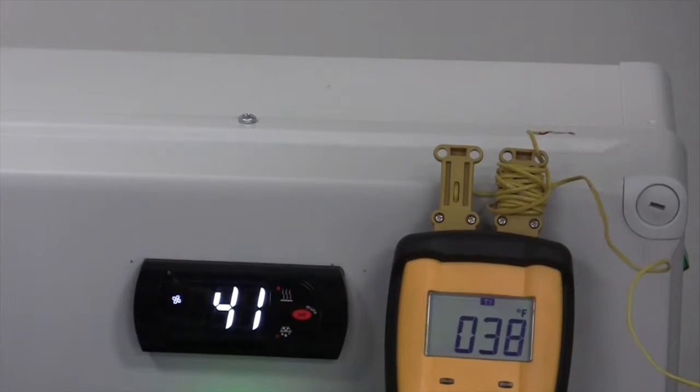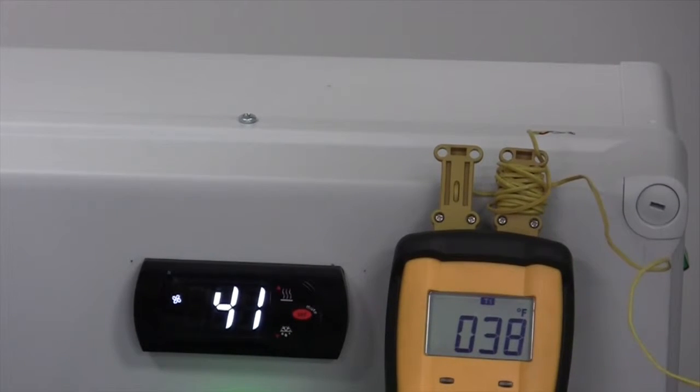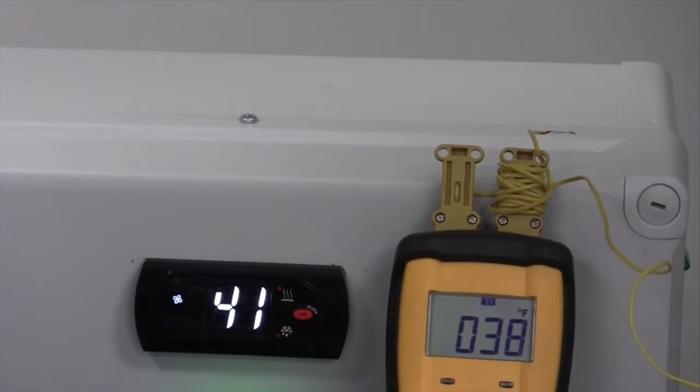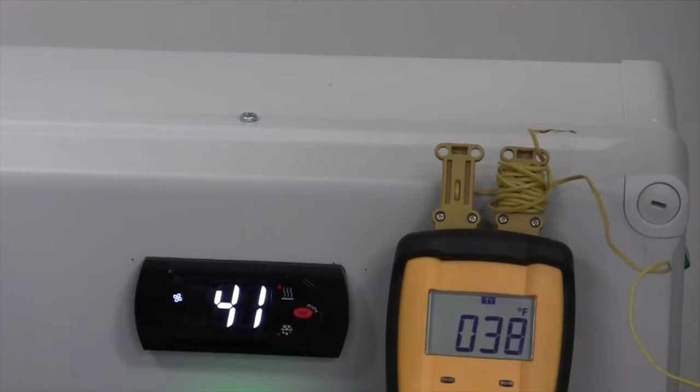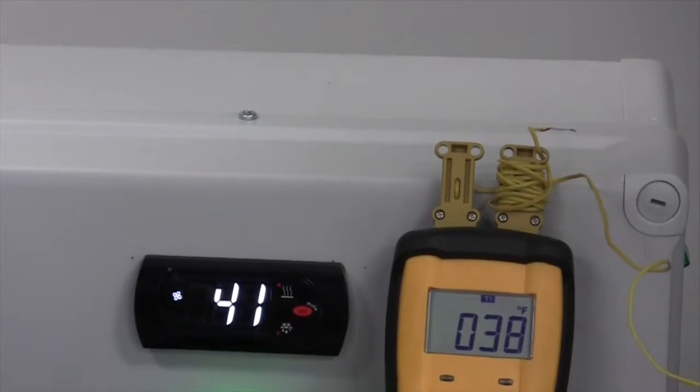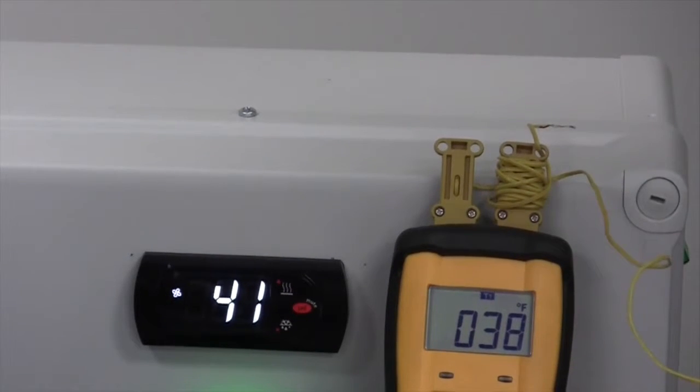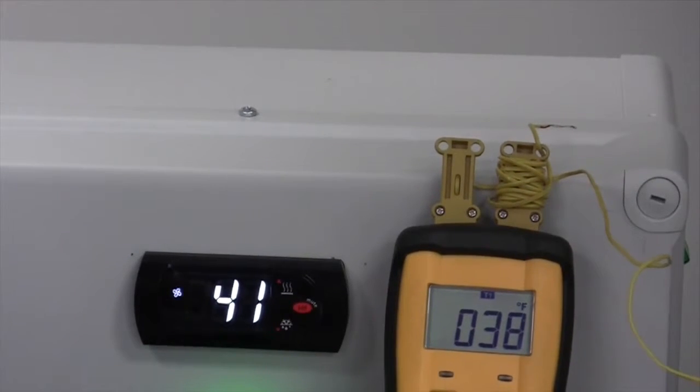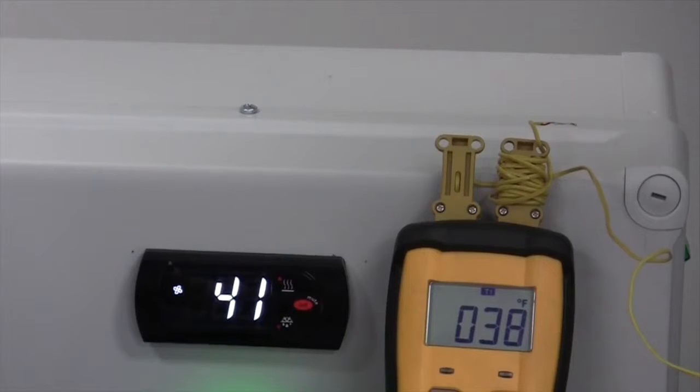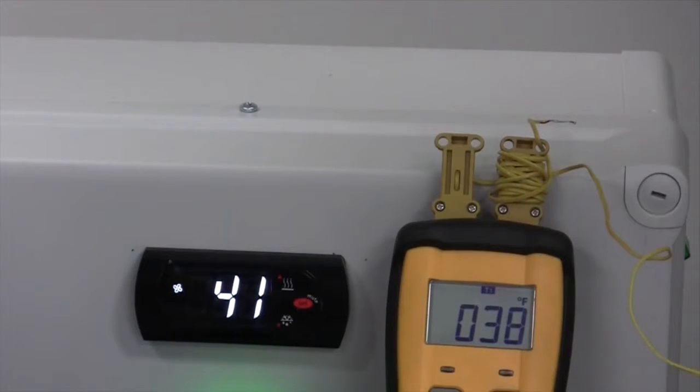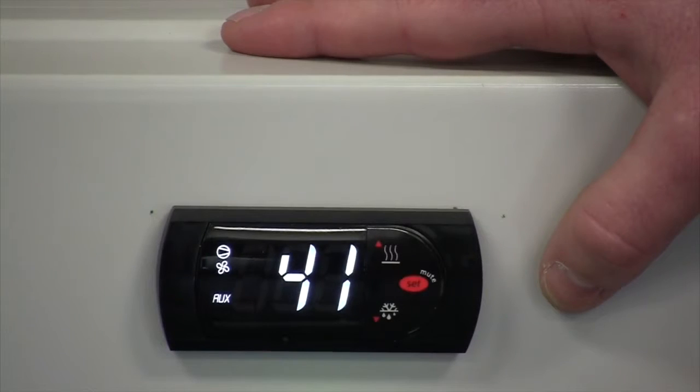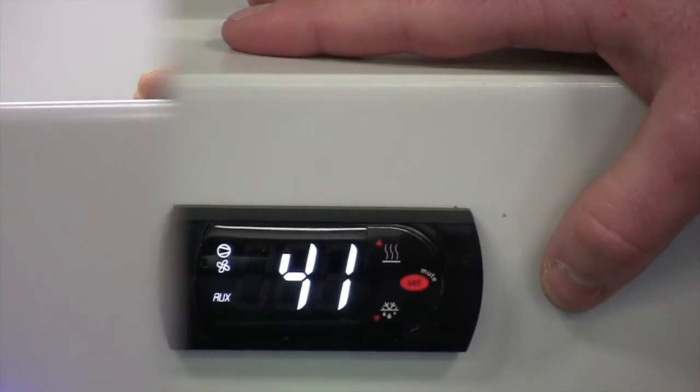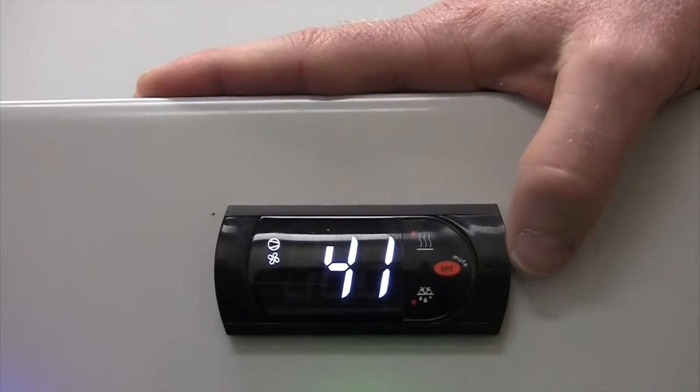So, if the sensing device reads 38 degrees and the control shows 41 degrees, you should decrease the current offset value by 3 degrees. And now, we'll go into showing how to change the calibration point.